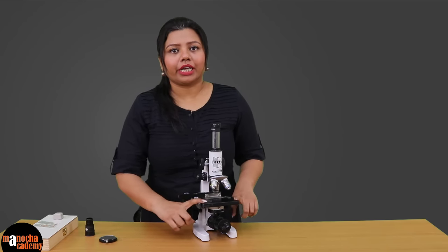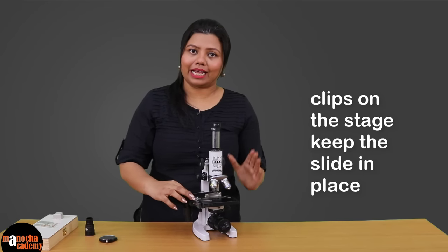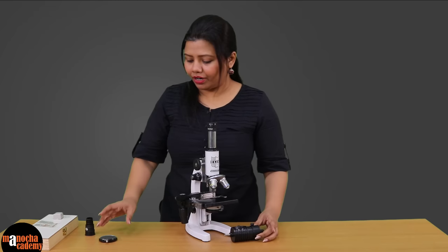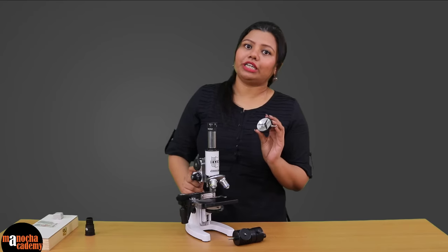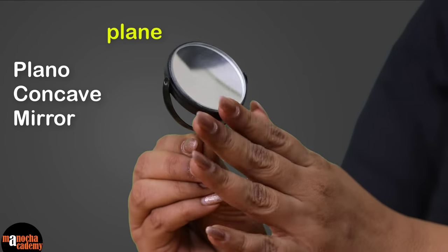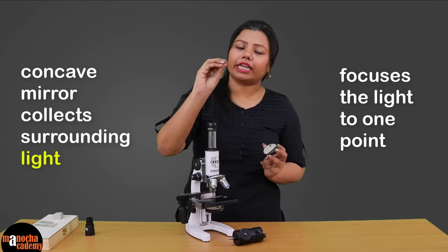This metallic stage is the base on which we will keep our specimen, and it has been provided with clips which will help us to hold the slide in position. The source of light in this microscope is the LED bulb. However, you might have seen a microscope in the laboratory where a mirror is used — a plano-concave mirror, meaning one side is plain and the other side is concave. The concave mirror collects light from different directions and focuses it to one point.